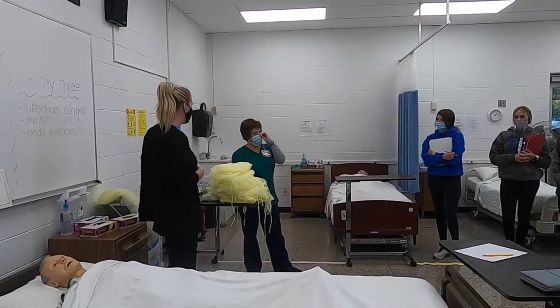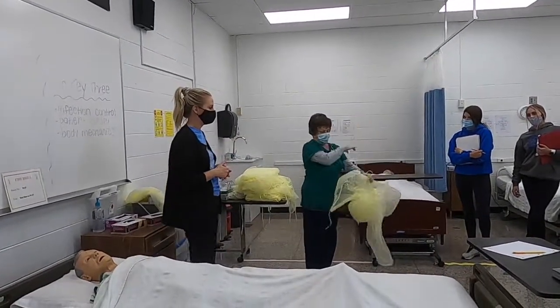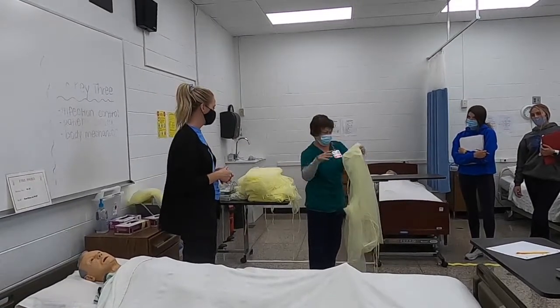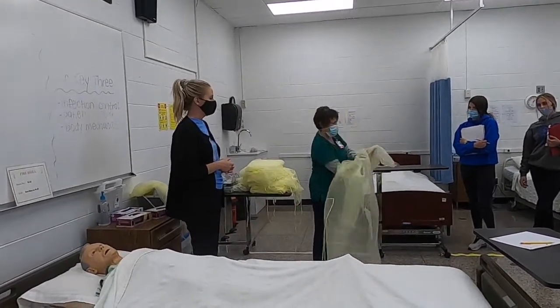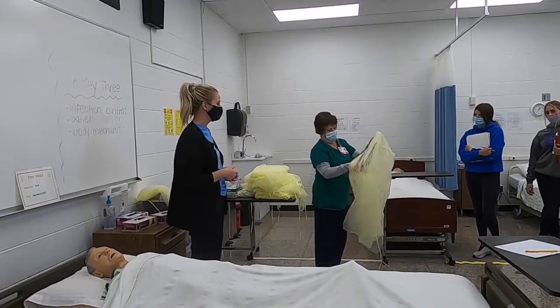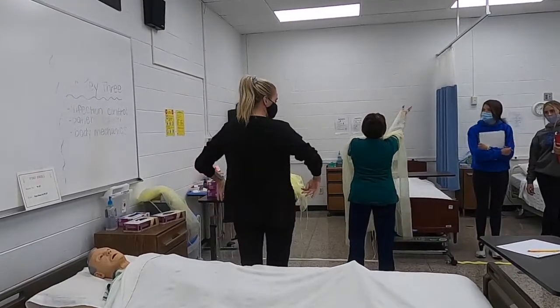The gown. Okay, so Jill's gonna put a gown on and we're gonna talk about what we're looking for when you put the gown on. We'd like you to reuse these, so they're kind of all folded differently. But we'd like you to reuse them so we have them available. So this one's inside out. Okay, so open to the back, okay? You don't wanna put it on like a jacket, you want the back side to be open.